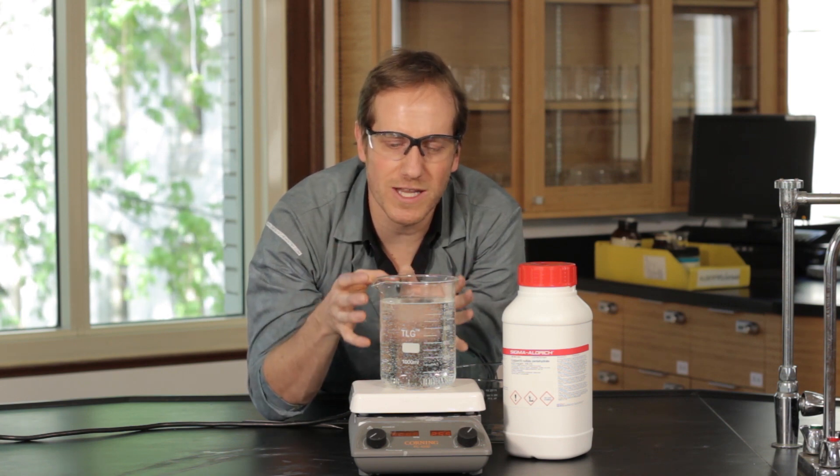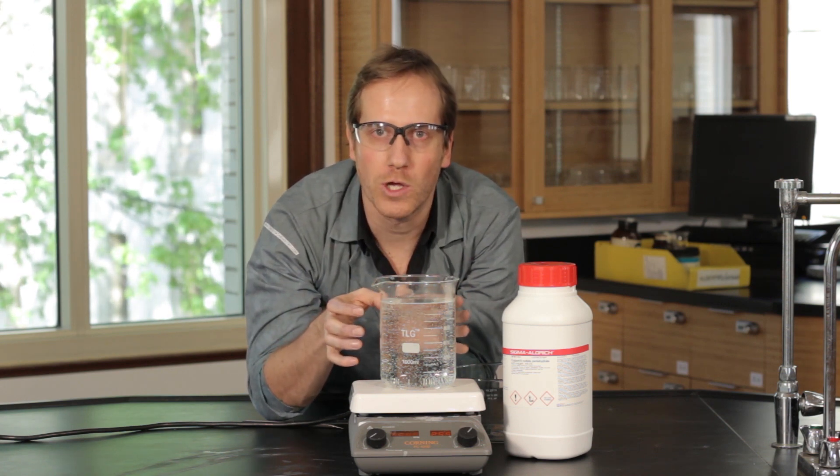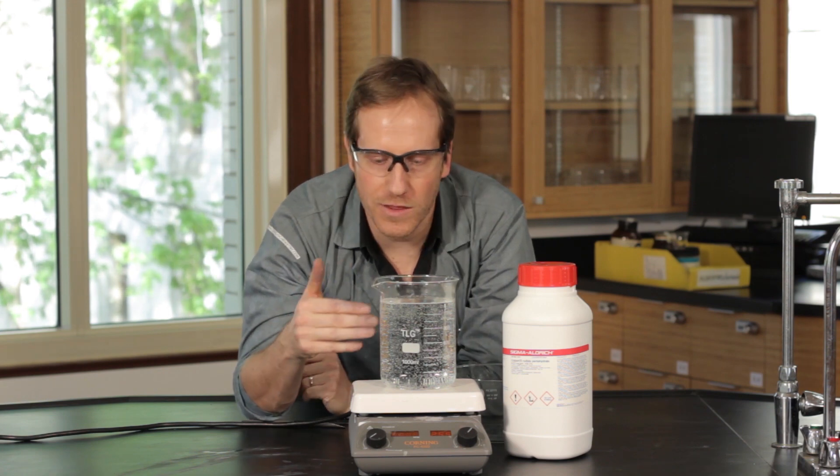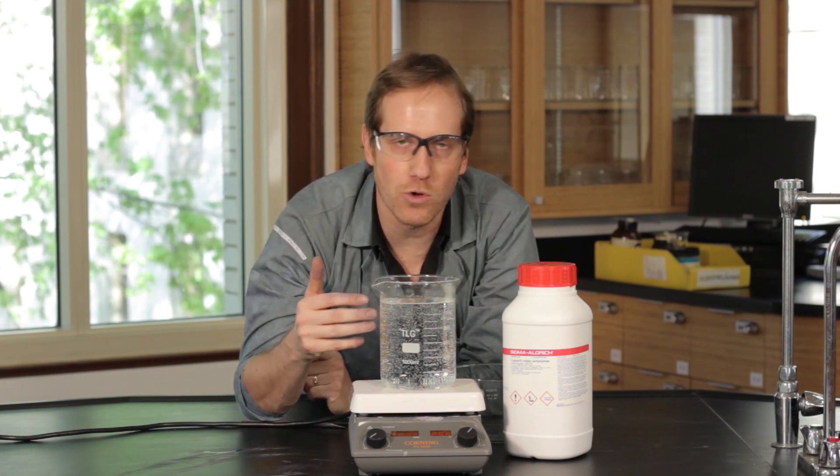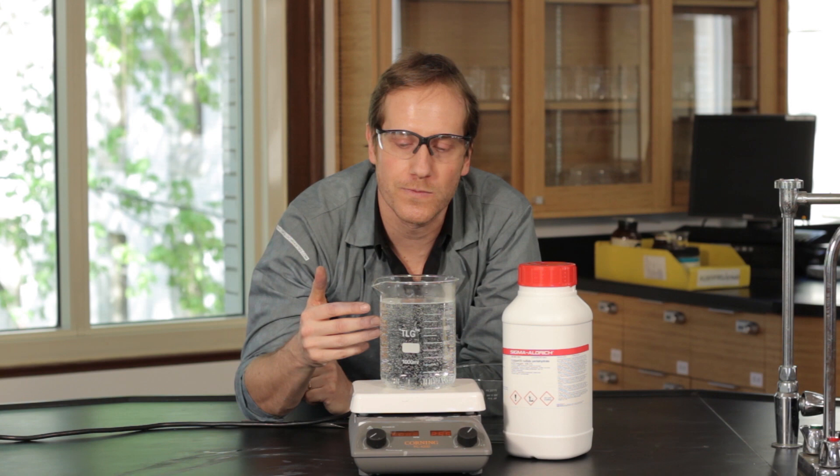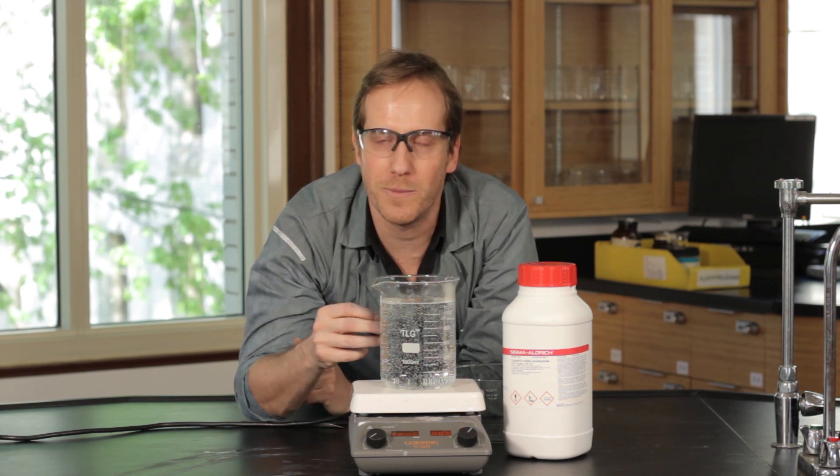The idea is I'm going to use only the liquid part and cool it down. When I cool down the liquid, the copper sulfate that's dissolved in it no longer can be dissolved because it's cool. So it's going to crystallize out and make a nice crystal.